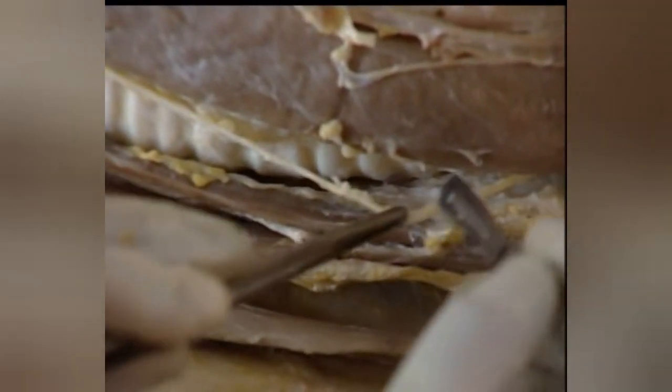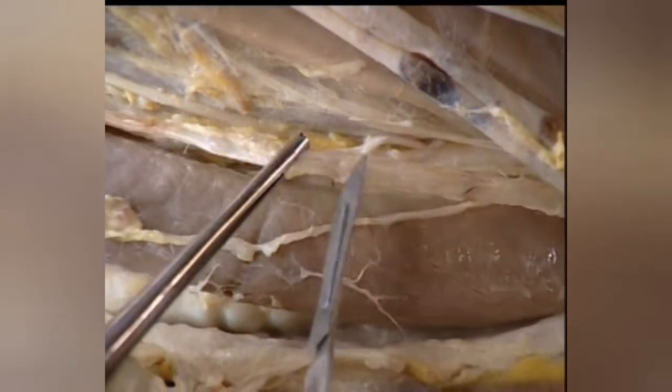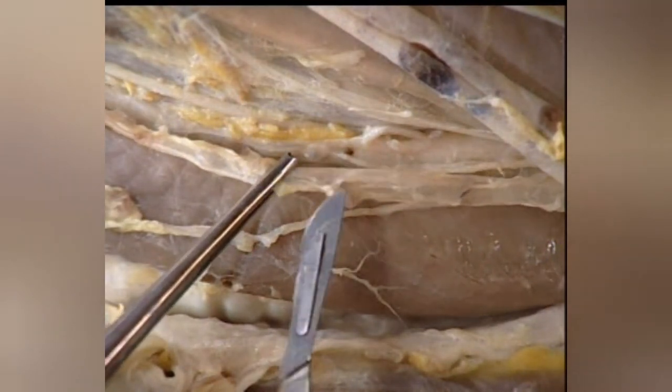Try to trace a nerve on the ventral aspect of the esophagus. This is the recurrent laryngeal nerve, supplying the laryngeal muscles except the cricothyroideus. If you carefully clean the fascia, you can find a thin-walled tube — the internal jugular vein.